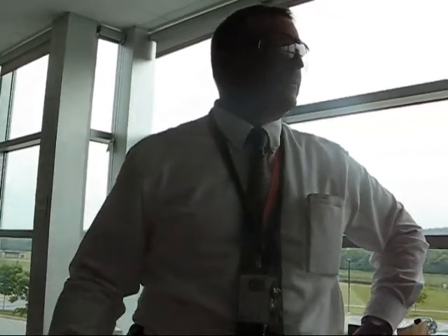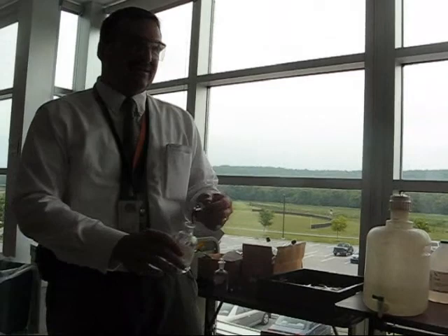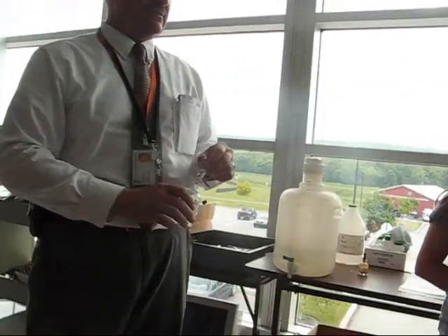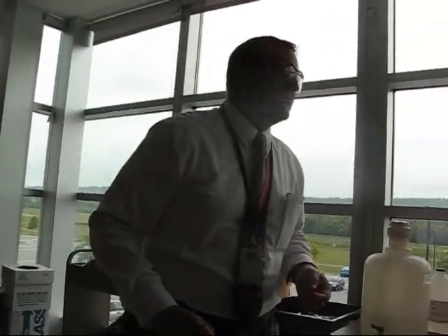the smell. Now, did you not get a smell of the bromine? Come forward then, please. Waft it. Well, you're tougher than most. That's all.